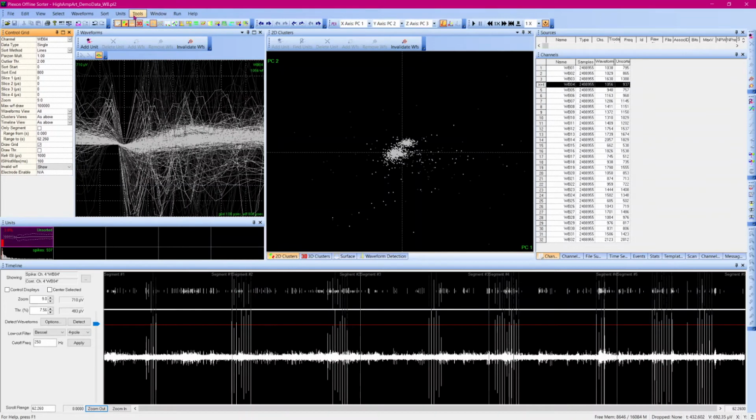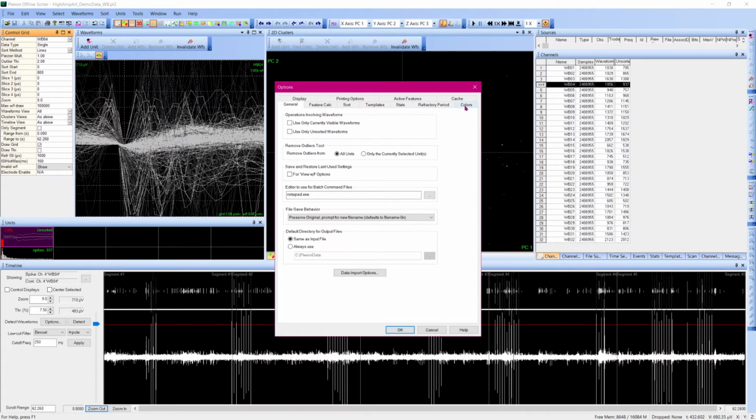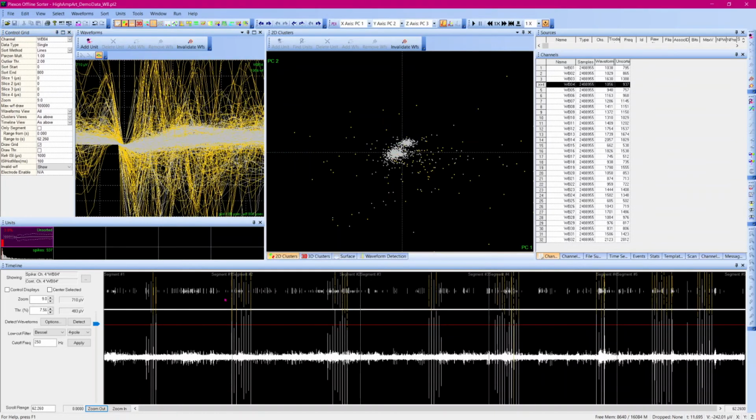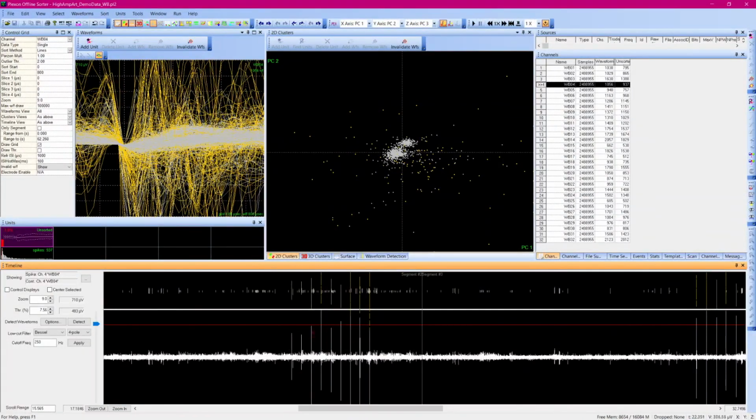This dark gray color is hard to see. To change the color, go into Tools, Options, Colors. I will change it to orange to make the invalidated waveforms easy to see in this video. The waveforms view now looks like a mess, but in the timeline view, you can easily see which artifacts were invalidated and which were not by our initial pass of the Invalidate High Amplitude Artifacts tool. This one here was missed likely because its amplitude did not meet the criterion we set. To get the remainder of these spurious waveforms, we will now apply the Invalidate Cross-Channel Artifacts tool.